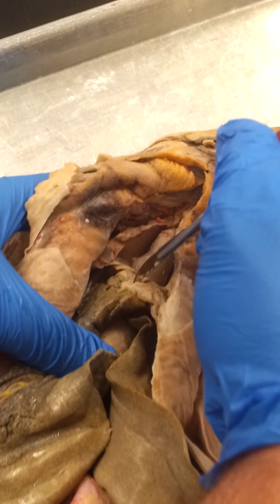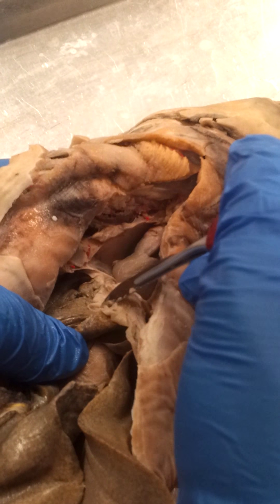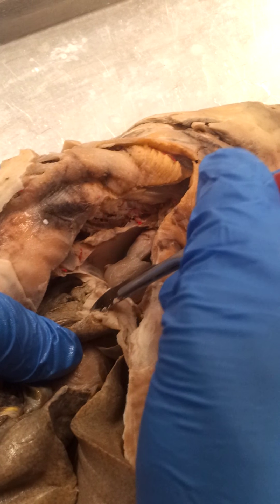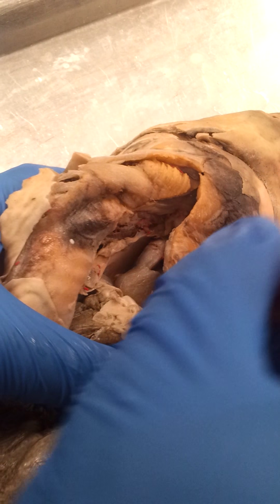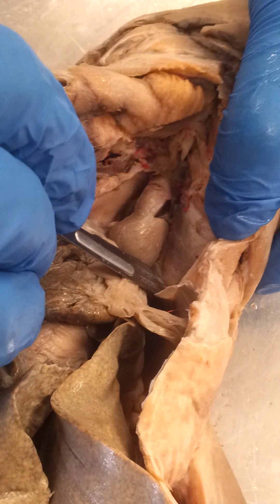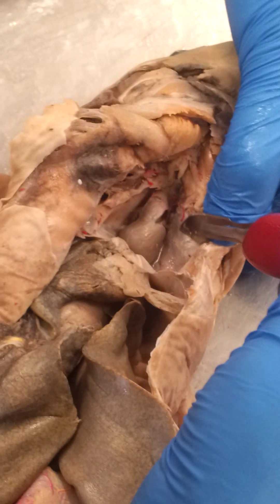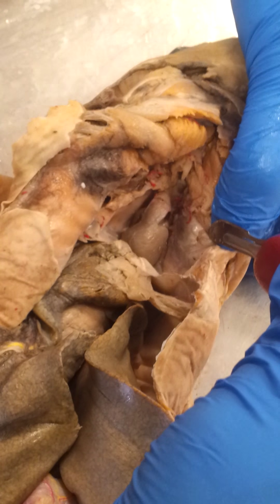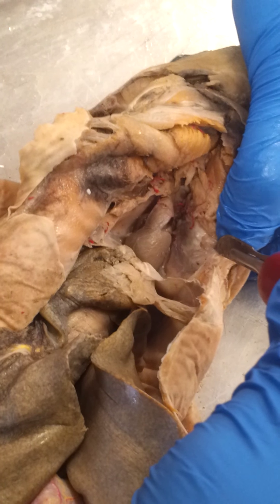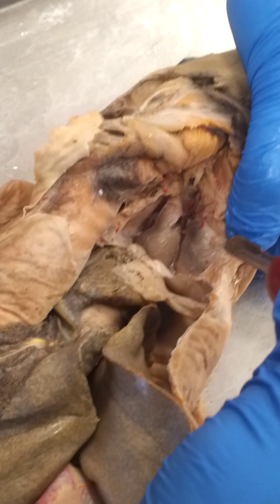Connecting to the liver is this little piece of tissue called the falciform ligament. To the right of the heart we have this tissue right here that is called the transverse septum, and also to the left and right of the heart we have the atrium walls.